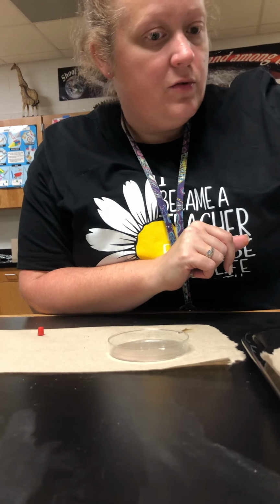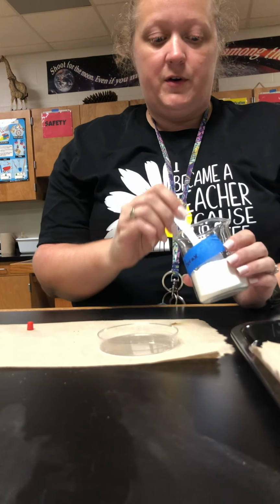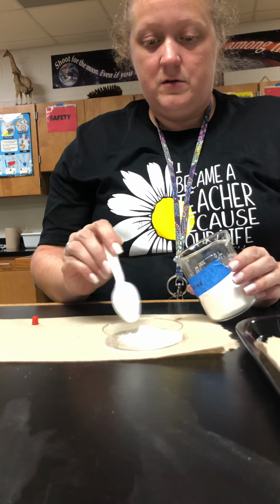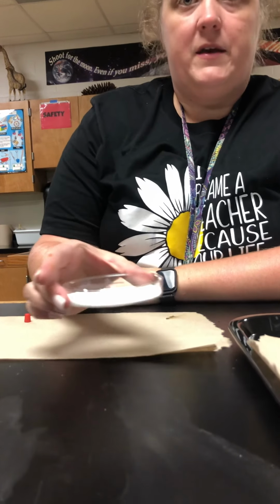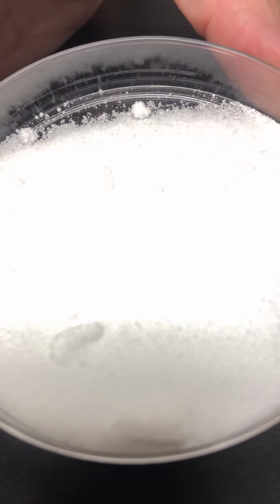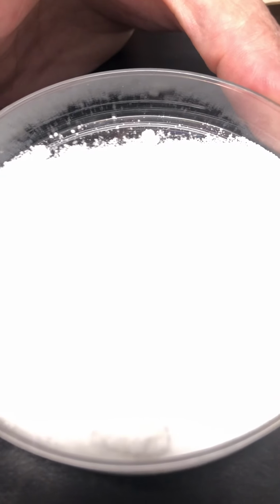Borax is used as a laundry booster. You can put it in with your laundry detergent to boost. Okay, so first off, we're going to make your observations. I know it may not be easy to tell with the camera, but this one is a little more shiny, more crystally, and reflects the light better.